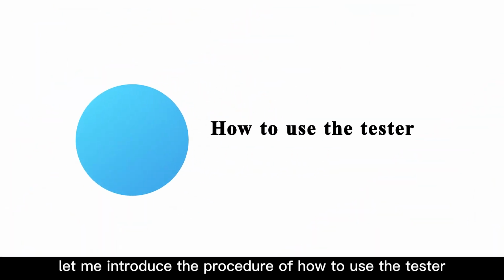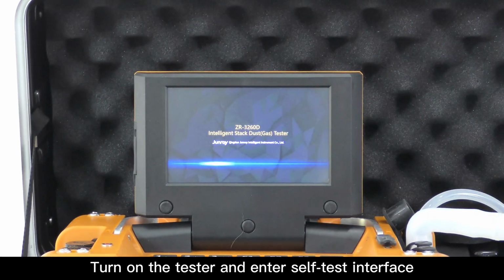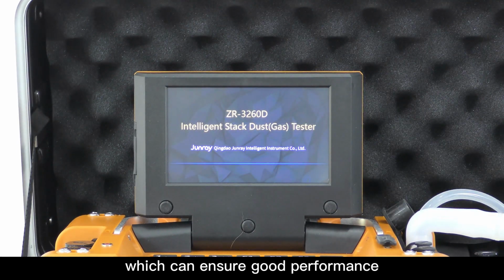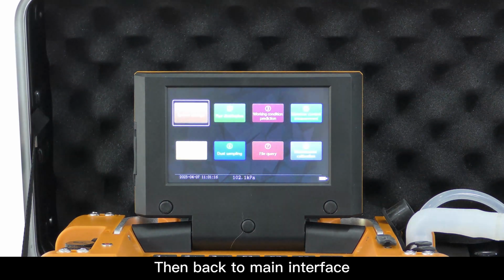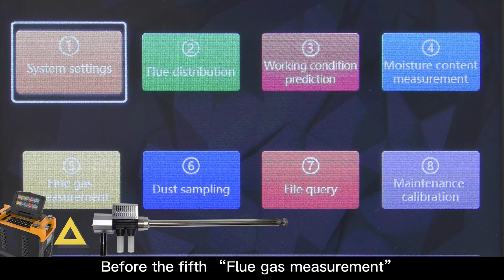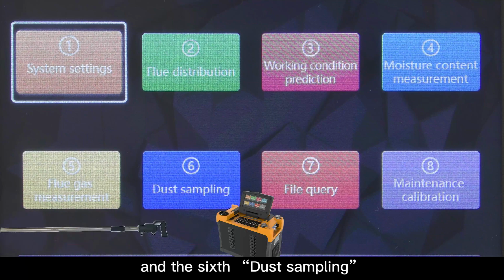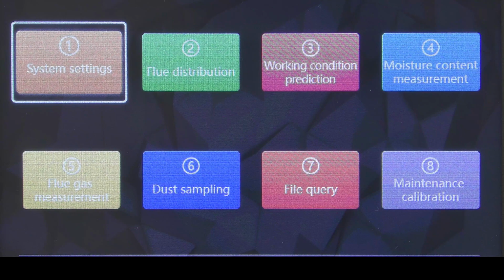Then, let me introduce the procedure of how to use the tester. Turn on the tester and enter the self-test interface, which can ensure good performance. Then back to the main interface, we can see 8 menus as shown. Before the 5th, flue gas measurement, and the 6th, dust sampling, we should finish the first 4 items.